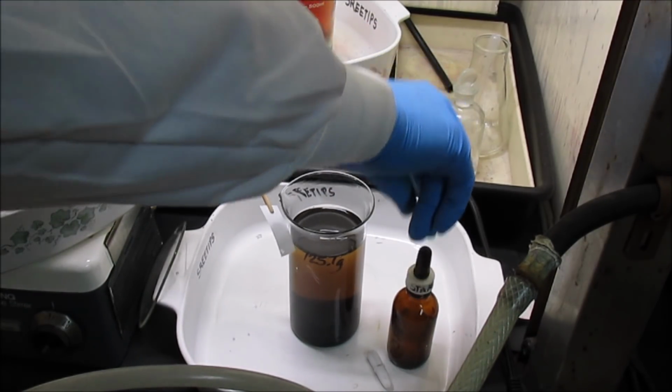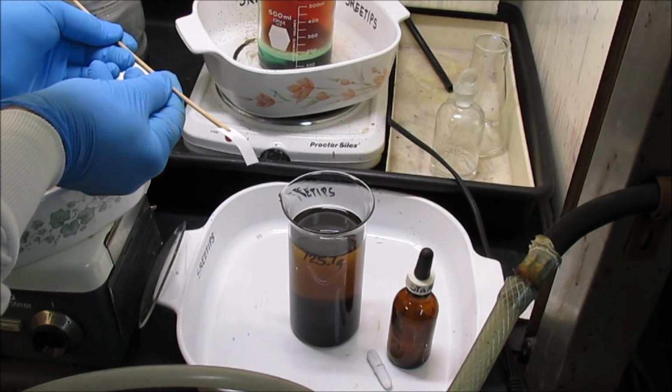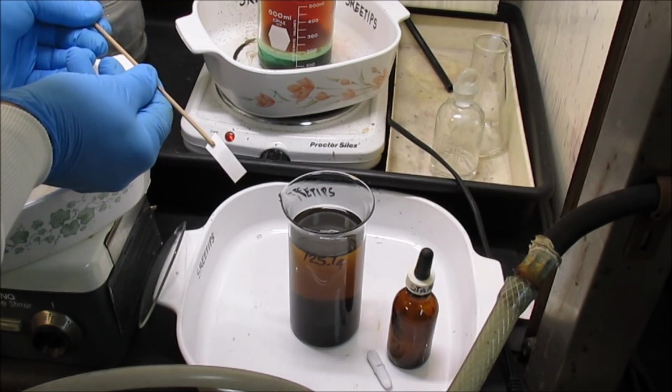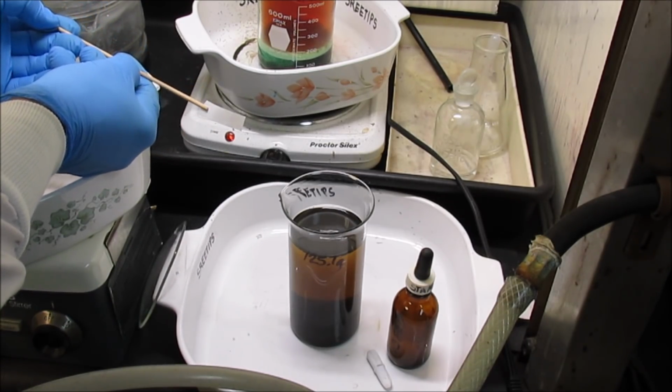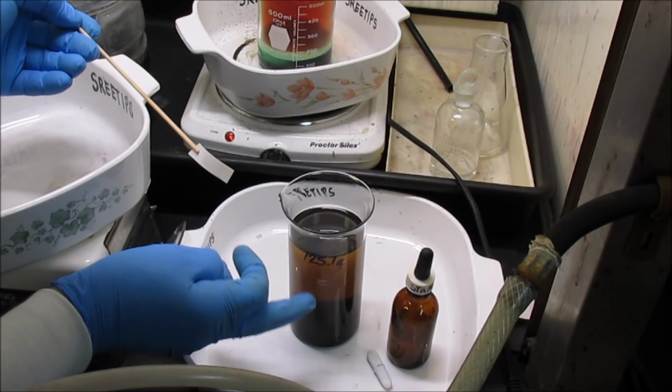See if you got anything going in the solution there, and I don't see anything. No reaction, so it's safe to conclude that there's no precious metals in this solution.